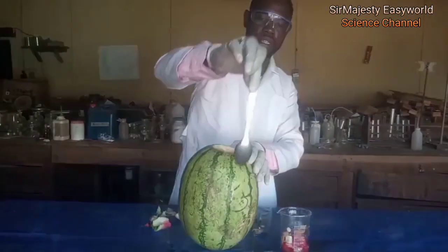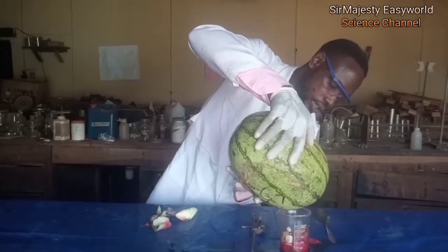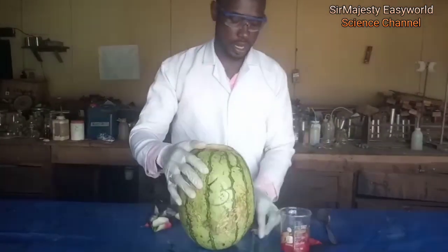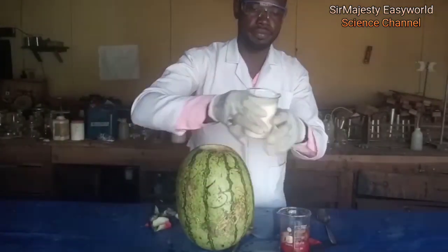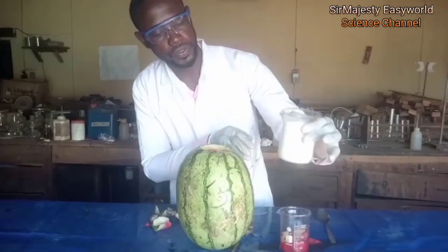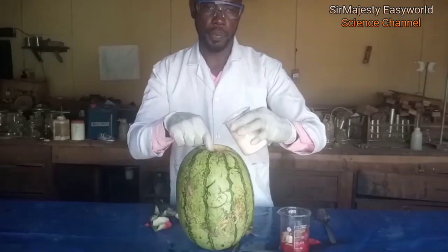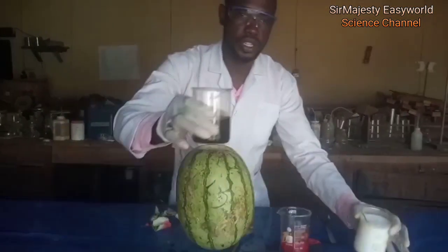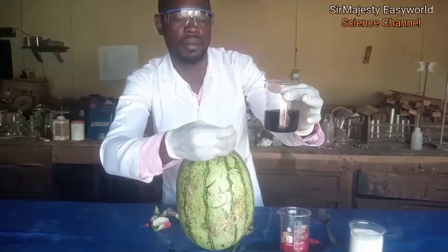It takes the whole sides of the spoon. Pour out the water. Next step: this is sugar, table sugar, pure table sugar, about 250 ml by volume, 250 ml of the beaker. That's the size. I don't know about mass, but this is what I'm using. I'll pour it here. Then this is dangerous — this is H₂SO₄. This is highly concentrated.